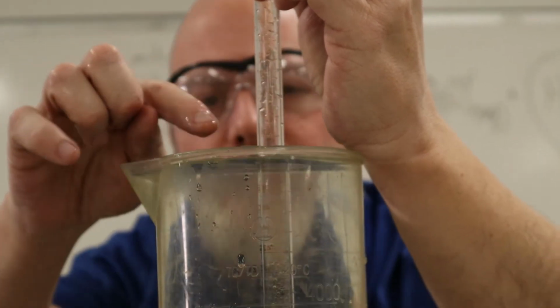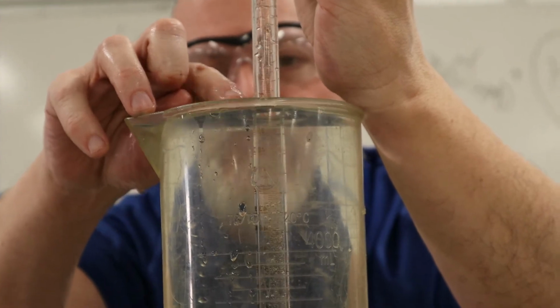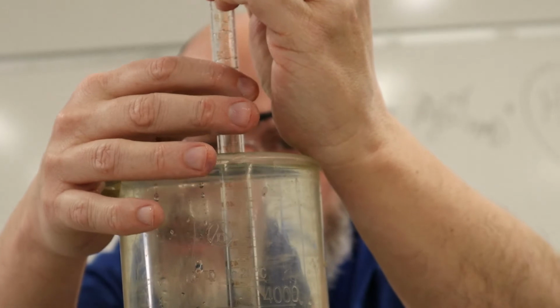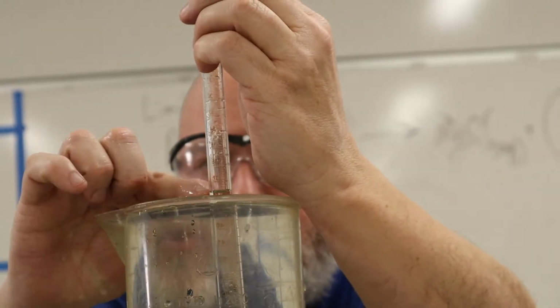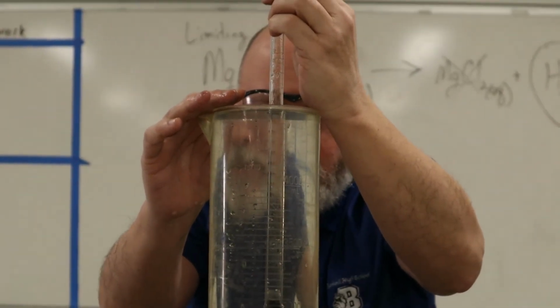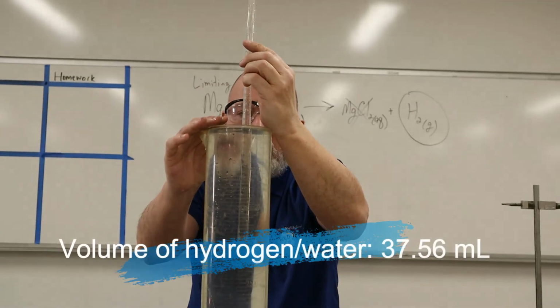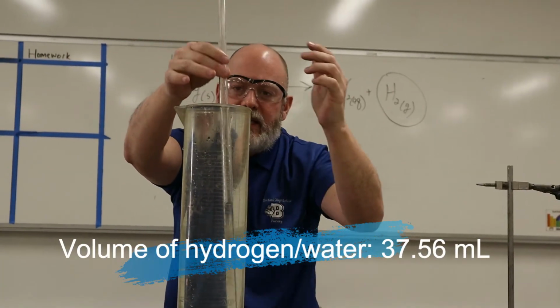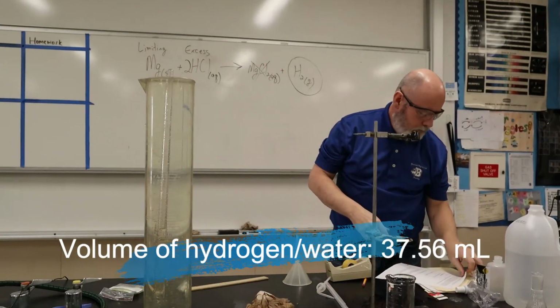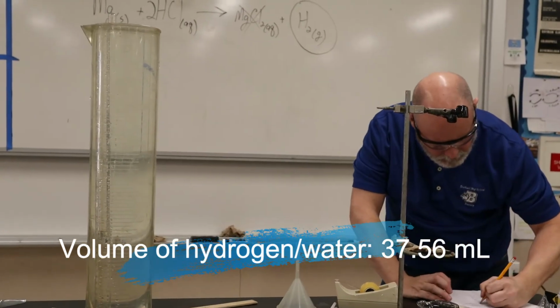Right about there. Now, why am I measuring the volume when this water line is equal to the water line in this big graduated cylinder? I'll explain in a minute, but let me take the reading when these two lines are equal. So it's 37.56. Okay? All right, so I'm gonna write that down. I'm gonna let it go. So the volume is 37.56.